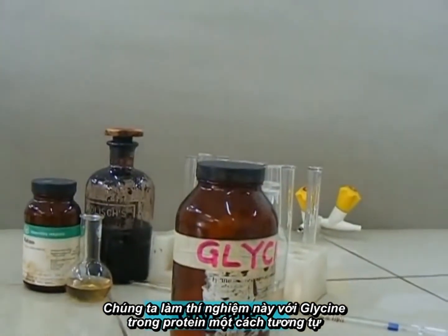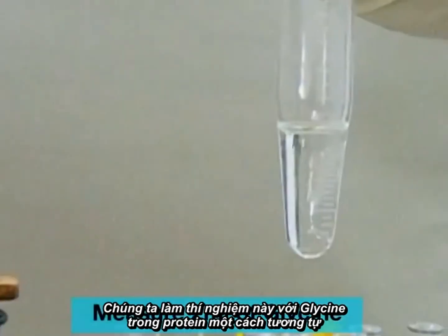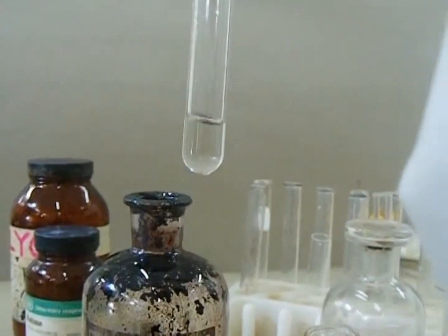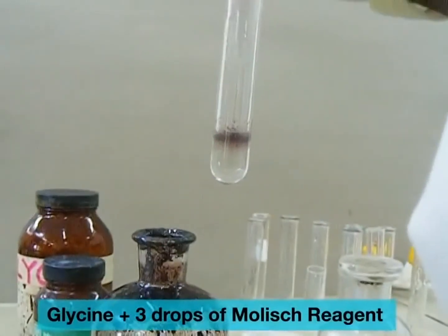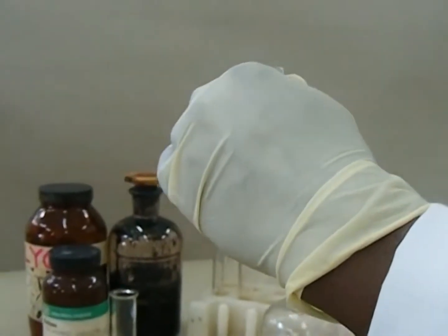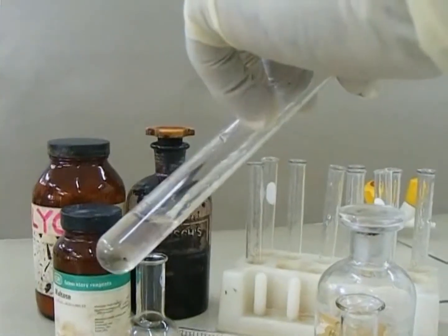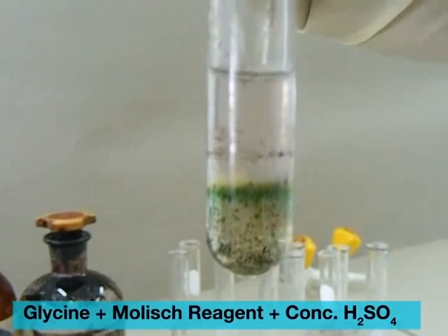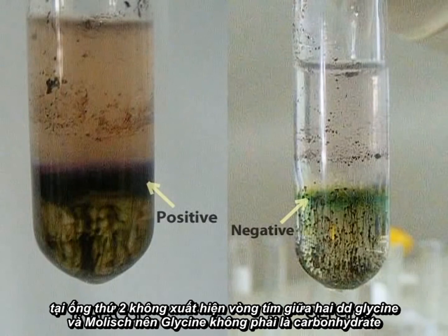The test procedure was repeated using glycine, a protein. A green coloration at the interface indicates that glycine is not a carbohydrate.